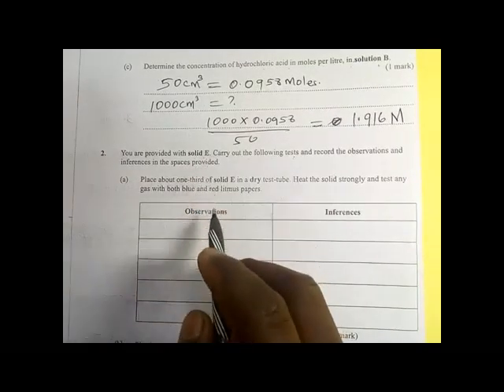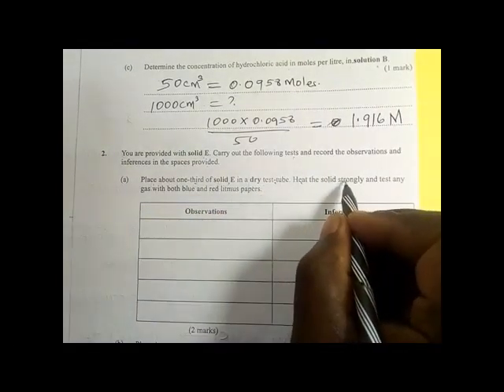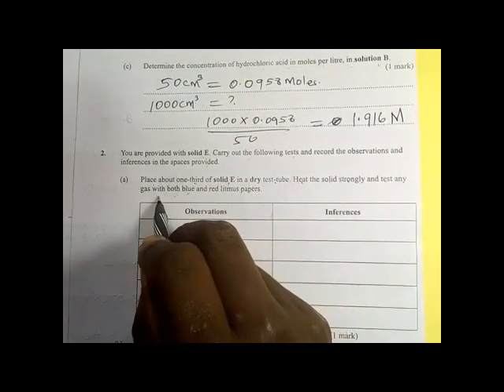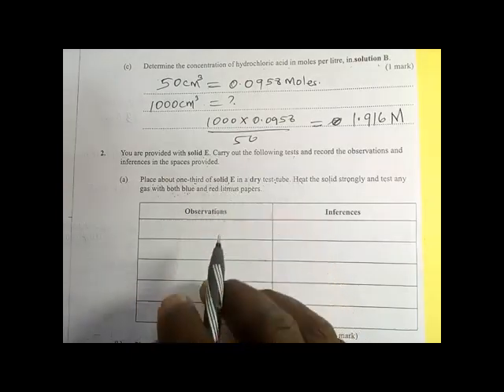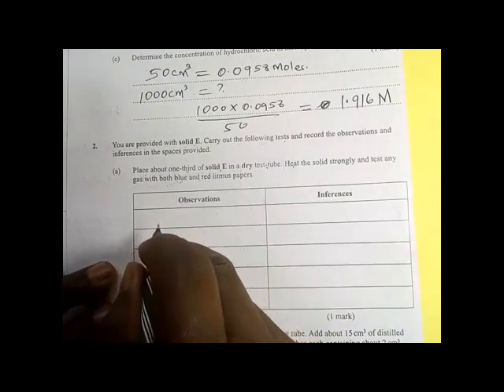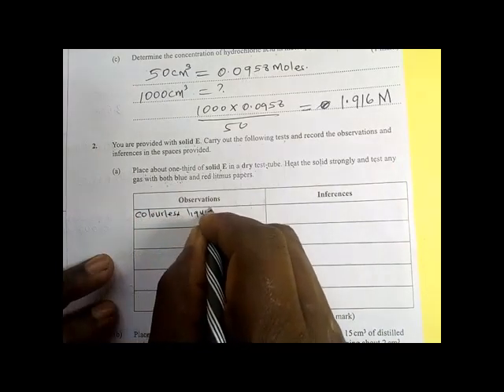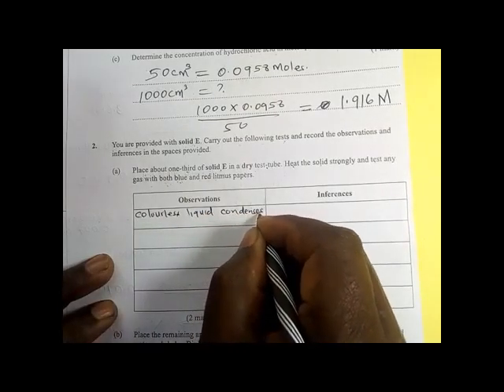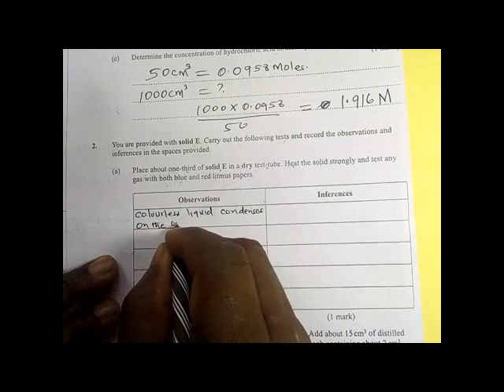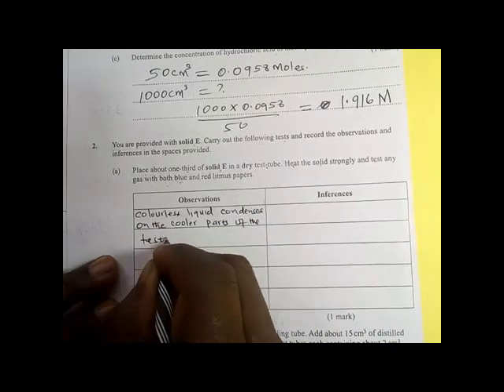You are provided with a solid. Place about one third of the solid in a dry test tube, heat the solid strongly, and test any gas produced with both blue and red litmus paper. The observation when you heat the solid is that a colorless liquid condenses on the cooler parts of the test tube.